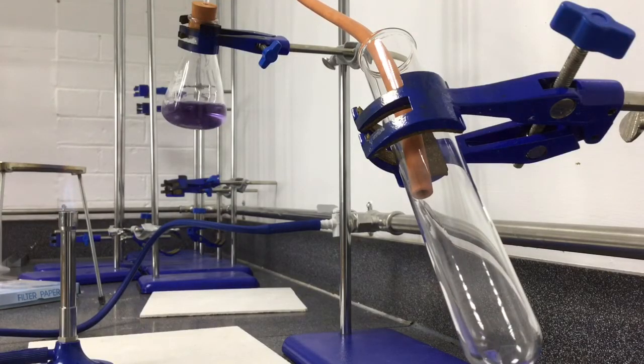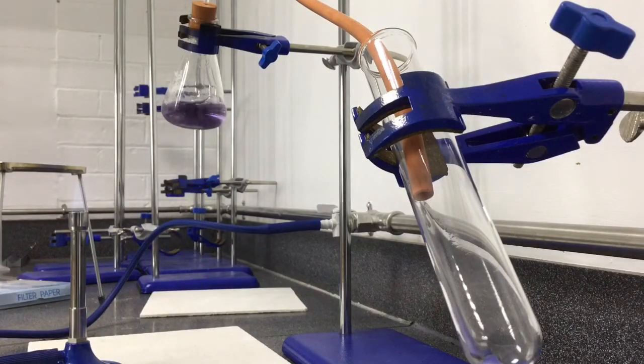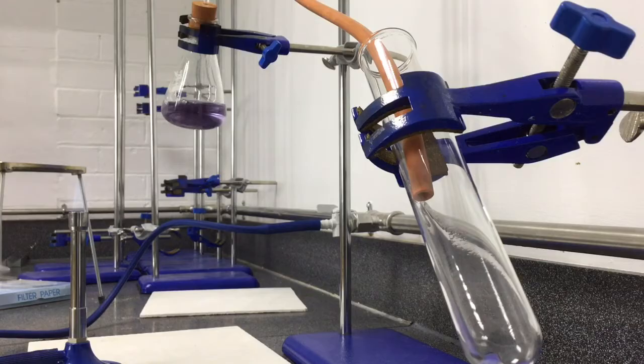After a short while, you will begin to see pure water droplets emerge from the delivery tube. We term this pure water our distillate, as it has been distilled from our mixture.